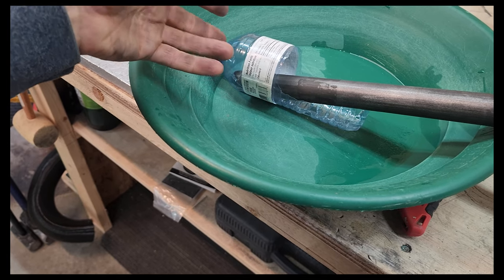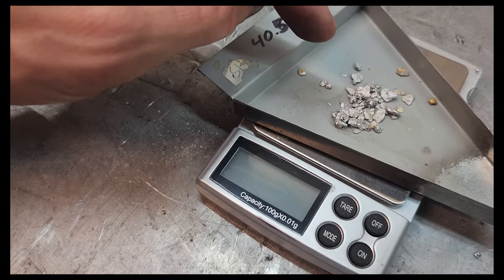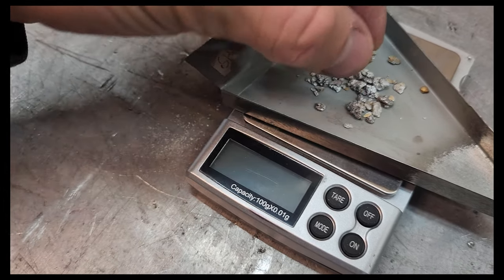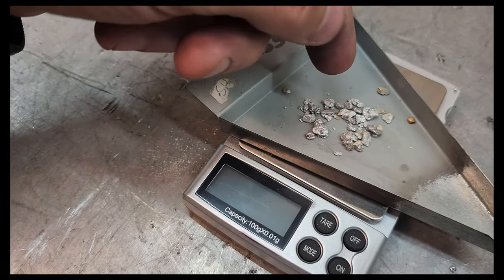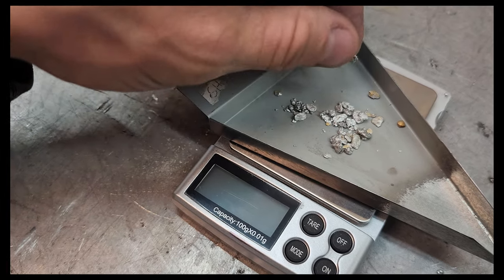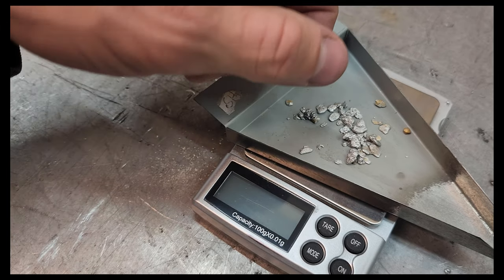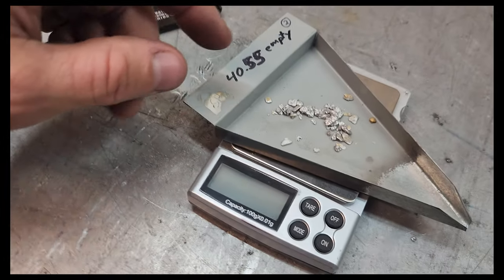At least that's what I read in the document, so I don't want that to happen — that's what this water bottle design is about. Mercury does slowly evaporate at room temperature. So if you were to store it in an open container in your house for years, or if you spilled a little mercury on your rug, you might want to get rid of that rug. But as far as just handling it like this — it's the kind of thing they used to take out of a thermometer and let you play with in your hand a little bit back in grade school, until that became a big no-no.